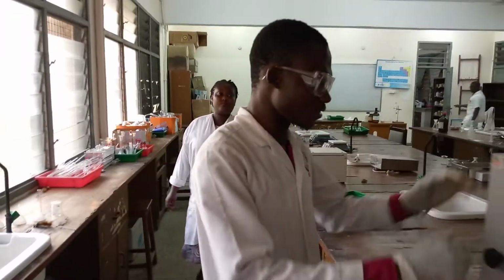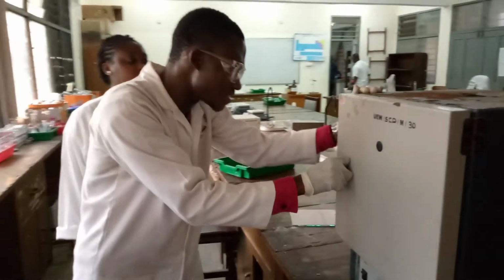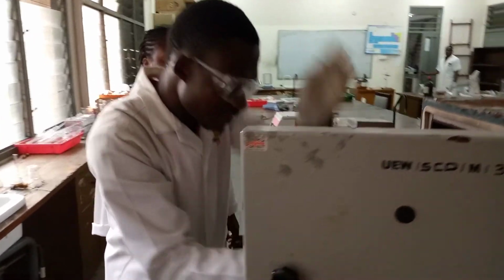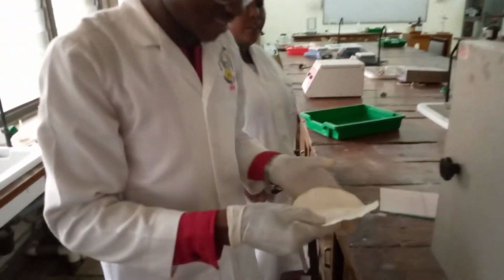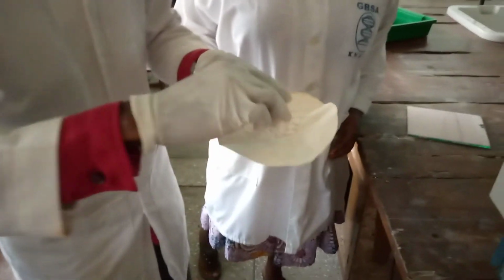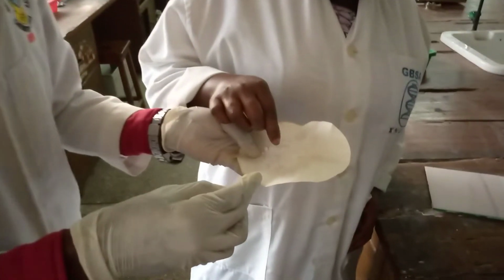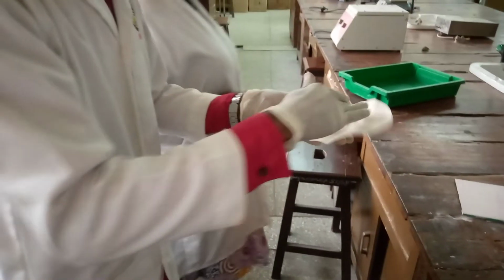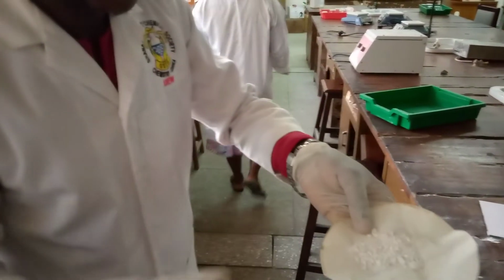So viewers, I'm coming back to check whether my sample is dry. My 5 minutes is up. I'll open it, then I'll pick my sample, then I'll close my oven back. So viewers, you can see, my sample is dried. It's well done. Can you see that? Can you feel it? And it's hot too. My sample is dried.